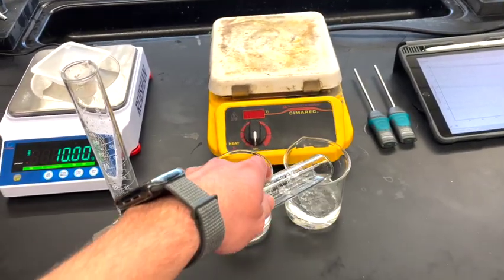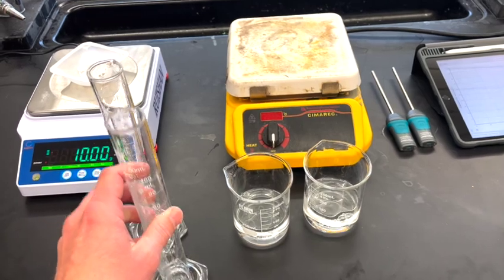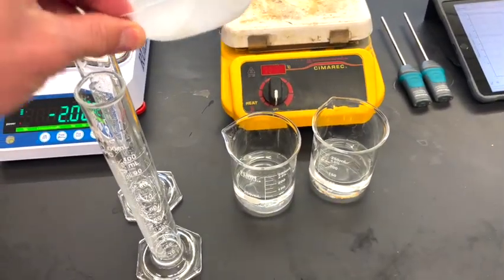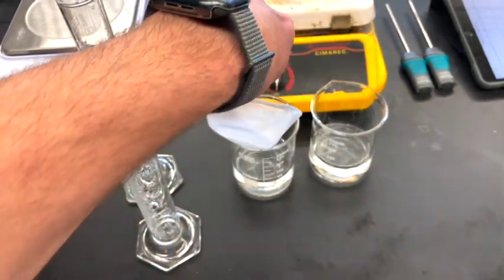I'm going to put 100 milliliters of water in each one of these beakers. In this beaker on the left, I'm going to add 10 grams of sodium chloride. This is going to produce a solution of sodium chloride.